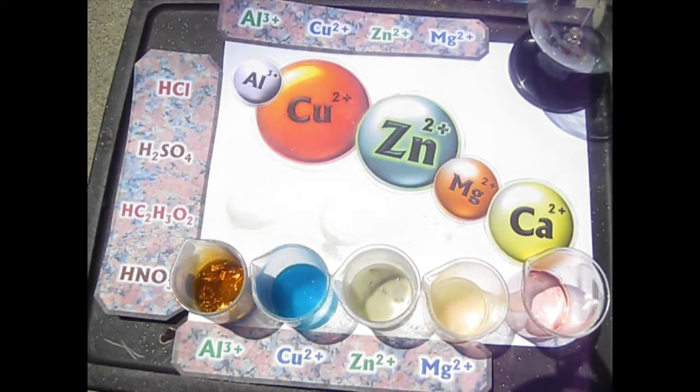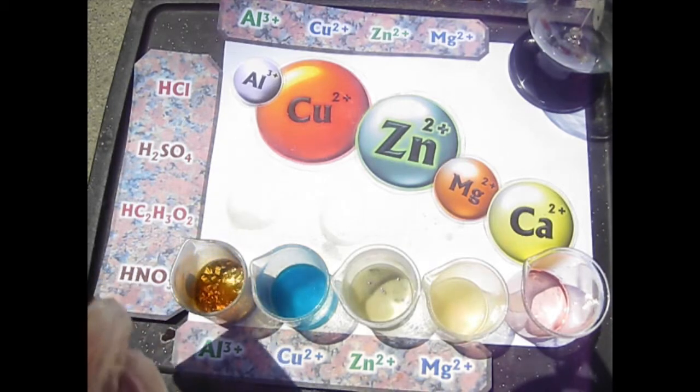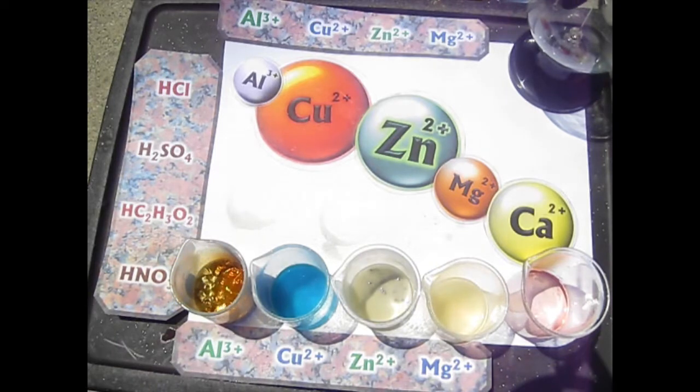So it took a while for the aluminum to get started, probably because it had an oxide layer around it. But now it's going pretty well. It started way after the other reactions had pretty much stopped. And the only thing that might have affected it is I did put in a few drops of universal indicator, and nitric acid is one of the acids that reacts with universal indicator. That could have been the trigger reaction that led to this reaction. Okay, so I'm trying to stay out of the fumes of this. But this is a pretty good reaction, so it did wind up reacting with the aluminum, just not immediately.